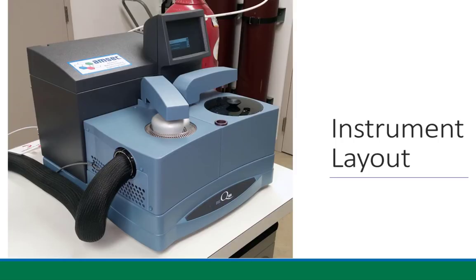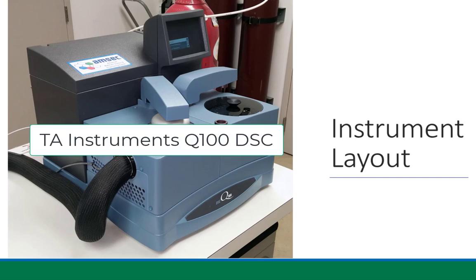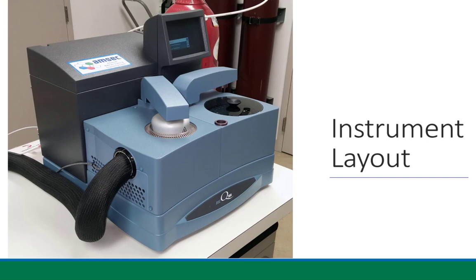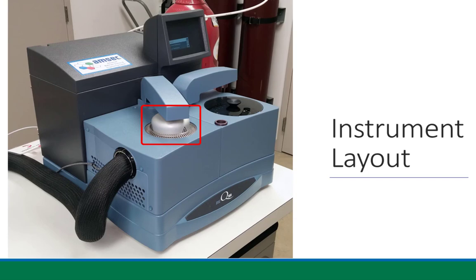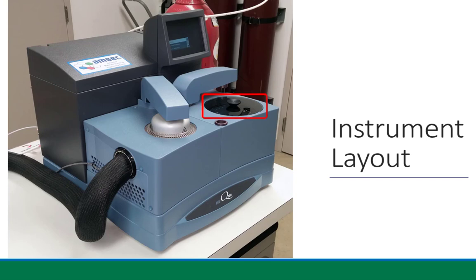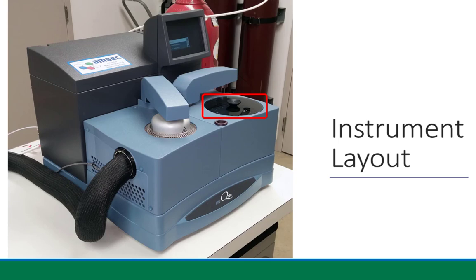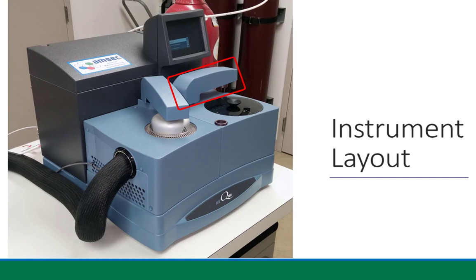Let's take a look at the layout of the instrument before we get into how things work. Most of the action takes place inside the furnace, located here, where the heating and cooling takes place. Over here we have the autosampler tray, where samples are stored while waiting to be run or after they've been run. This is the autosampler arm — it picks up samples and loads them into the furnace cell.